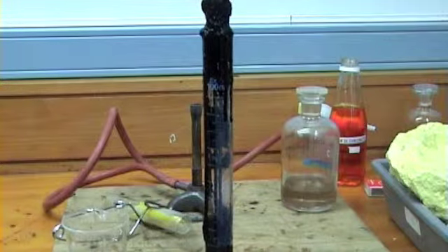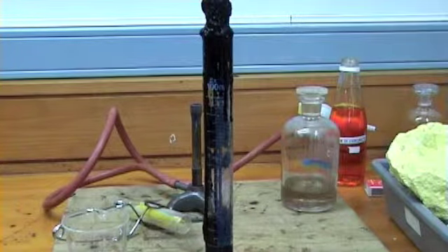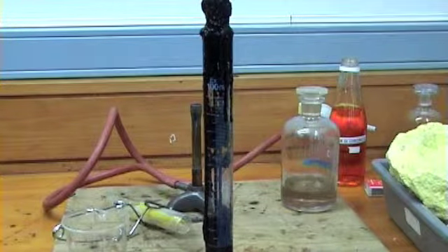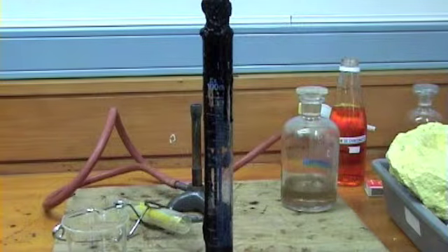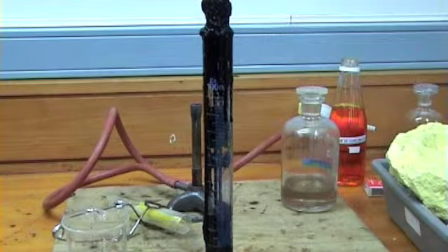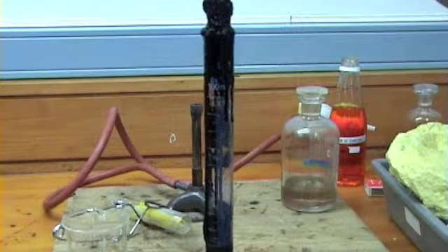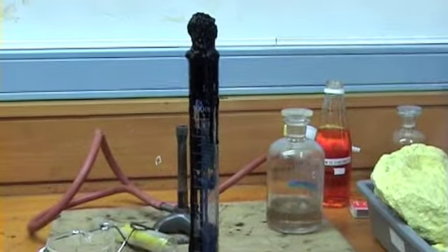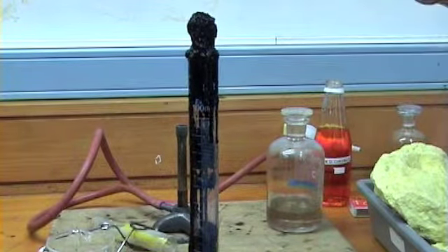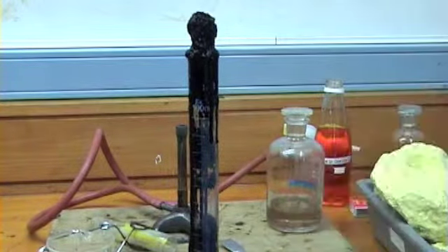All right, that's probably about it, because now the heat and vapor can escape. No, it won't. So can you try to break it? It'll set solid. I'm not touching it. It's got concentrated sulfuric acid in it. Just grab the measuring cylinder and try to hit on the thingy. No, it's quite solid. See, it's a form of charcoal, but it's kind of spread right out into a crystal structure with lots of bubbles in it. It's like volcanic rock, kind of.